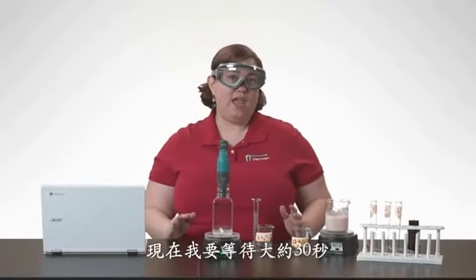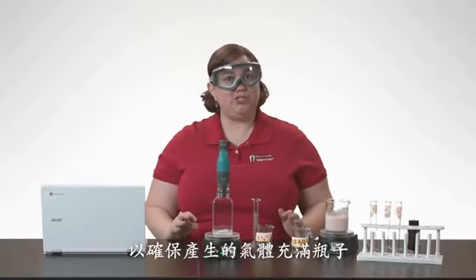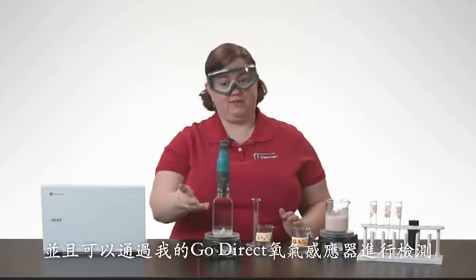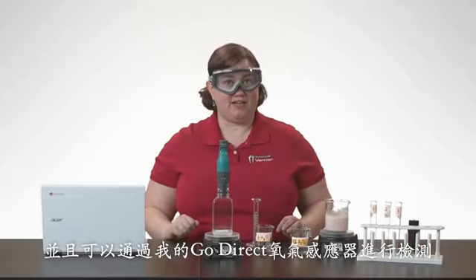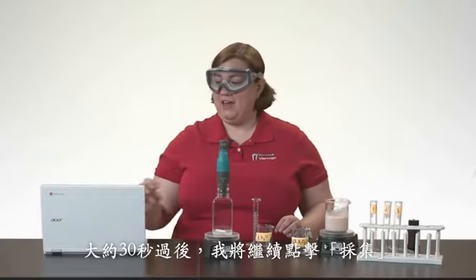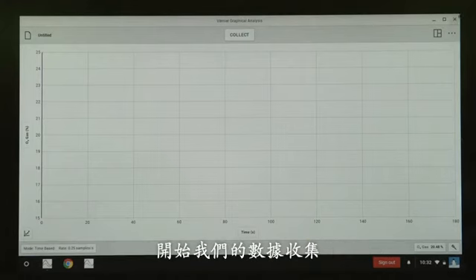Now, I want to wait about 30 seconds to ensure that the gas that's produced starts to fill the bottle and can be sensed by my Go Direct oxygen gas sensor. So after about 30 seconds have passed, I'm going to go ahead and click or tap on Collect to start our data collection.